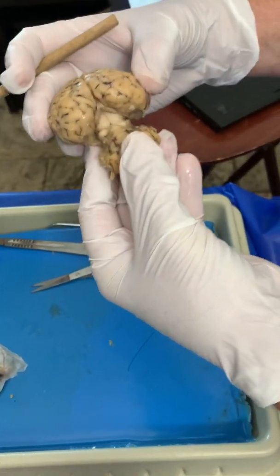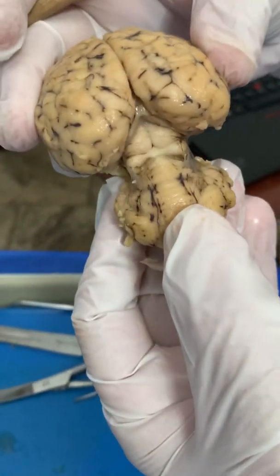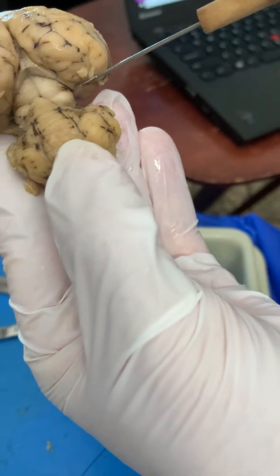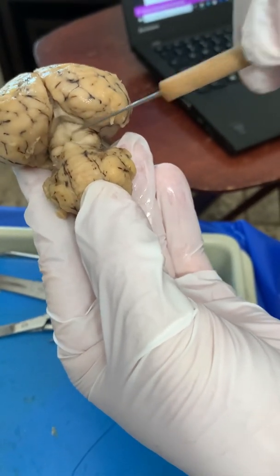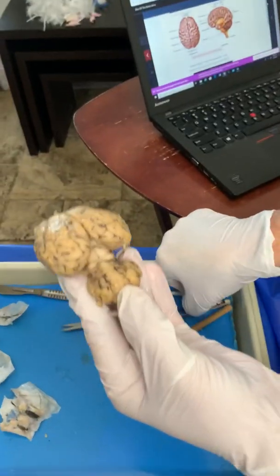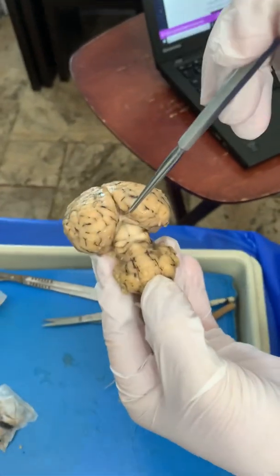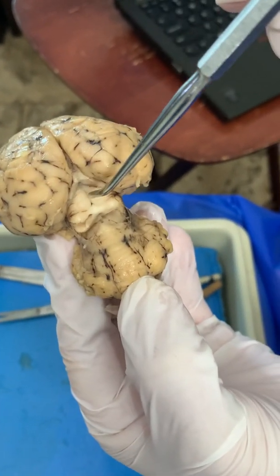What we would be doing is pulling this down. I don't know if you can see, get closer. When you pull this down, see these little blood vessels popping, little veins in here. There's an area in here called the choroid plexus. Plexus means grouping of nerves. Now right here, you have the superior colliculi, inferior colliculi, and up in here you have what's called the pineal body, or pineal gland. That's a gland we're going to look at in a second.